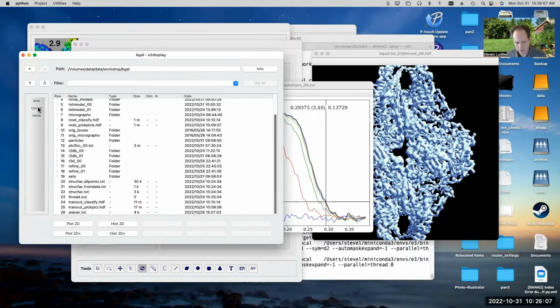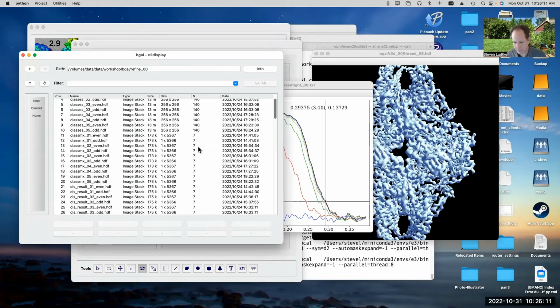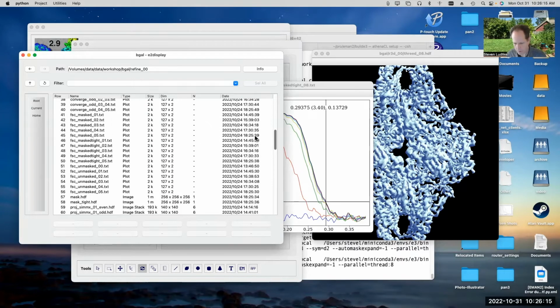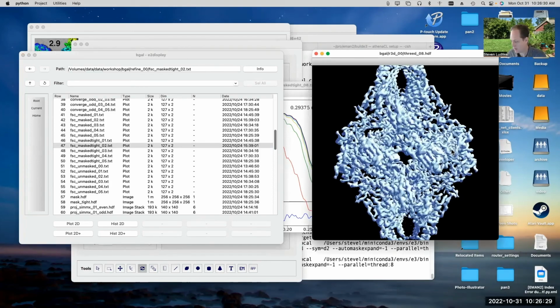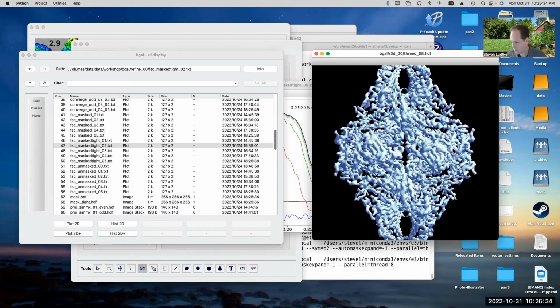Okay, the other refinement I ran, refine 0, 0, the first one with speed 5, took a little less than an hour to run. But you can see we started with just the initial model and immediately got to the final answer. We didn't have to run multiple programs. It just refined very nicely to the final answer.